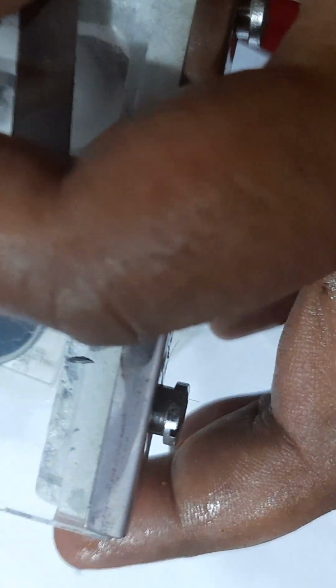And if I can show you here, probably, wait a minute. Yes, I can see something. You can see something. Okay, here, can you bring it here? Yes. Can you see the inner layer? Can you see the inner layer? Yes, the inner layer is fused with the female gametophyte, right?